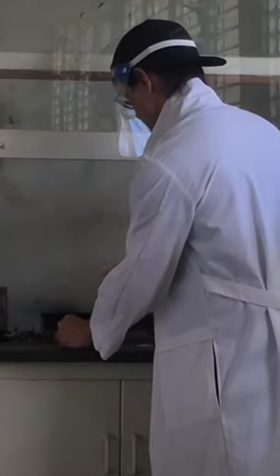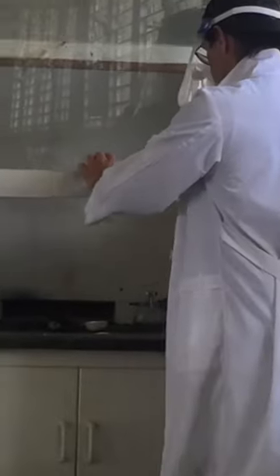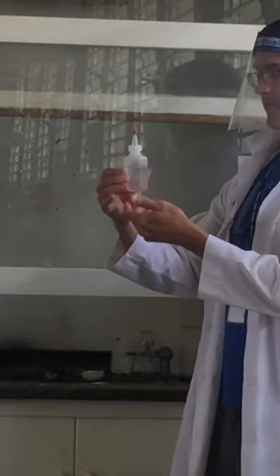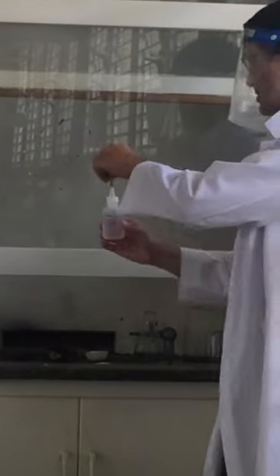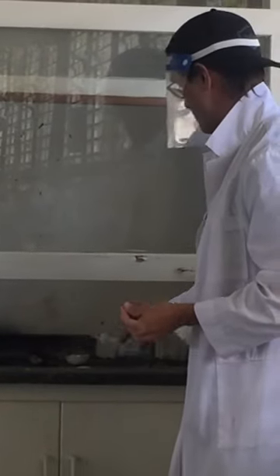If I were to just kind of leave this, it would eventually react. But I don't know about you all, but I'm kind of impatient, and I don't have time to wait around for this to just spontaneously react. So what I have here is a bottle of concentrated sulfuric acid in this dropper bottle, and I'm just gonna put a few drops on that to get it going.